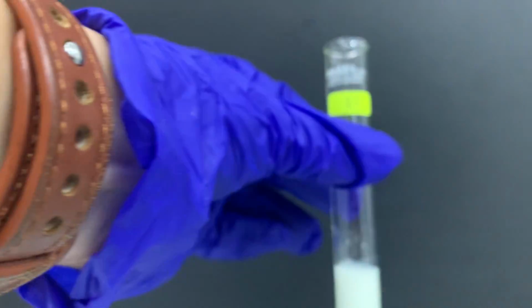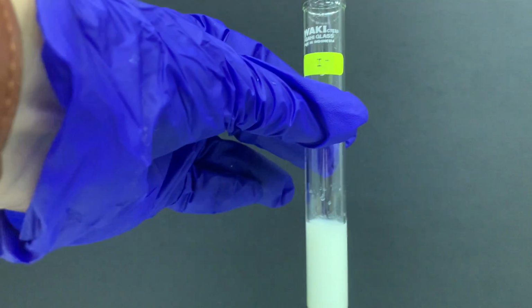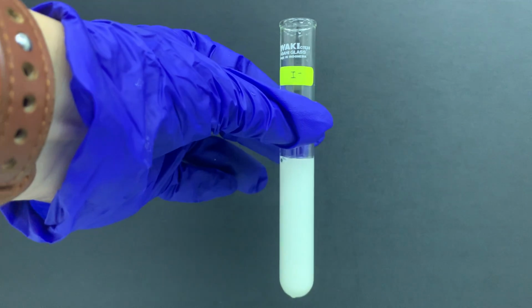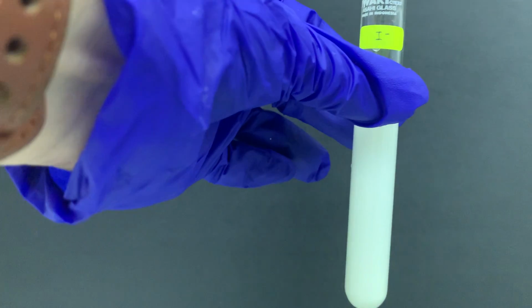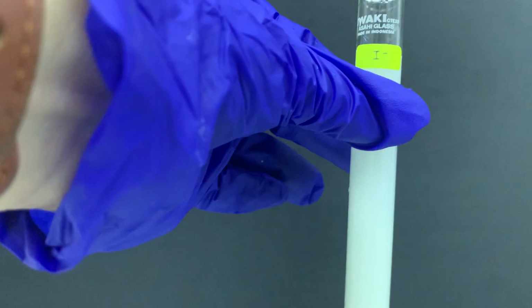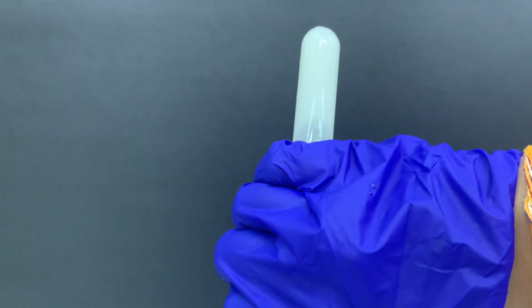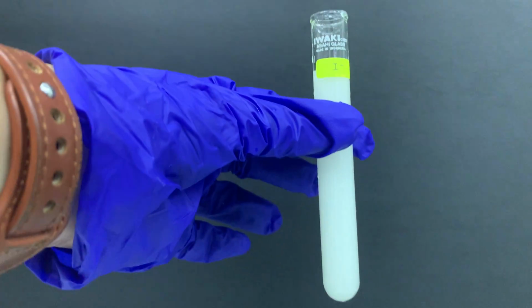And this is the last one, iodide ion. Iodide ion cannot dissolve in excess ammonia, but we still try. Yeah, we want to know whether it is possible or not, so we still try no matter what. So I still add a lot of ammonia. Okay, still add a lot of ammonia. Then I also still try to invert it. Okay, so I guess still a no. They cannot dissolve in excess ammonia.